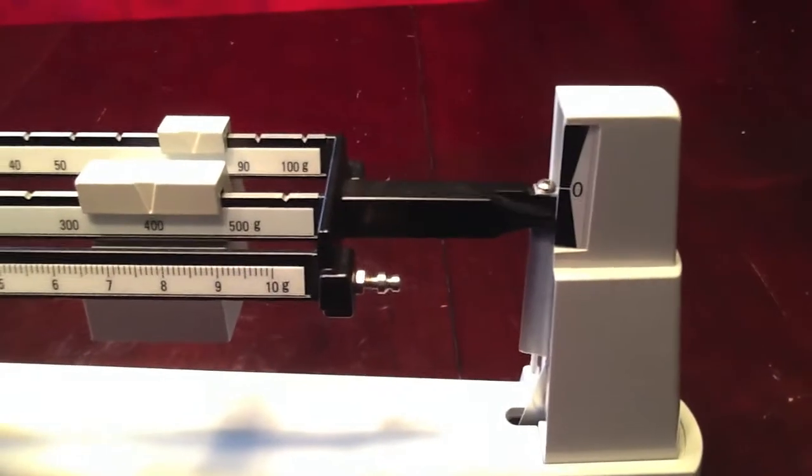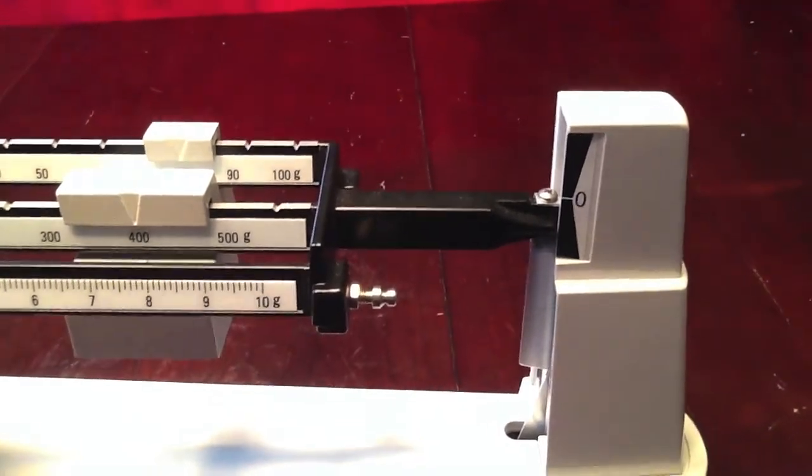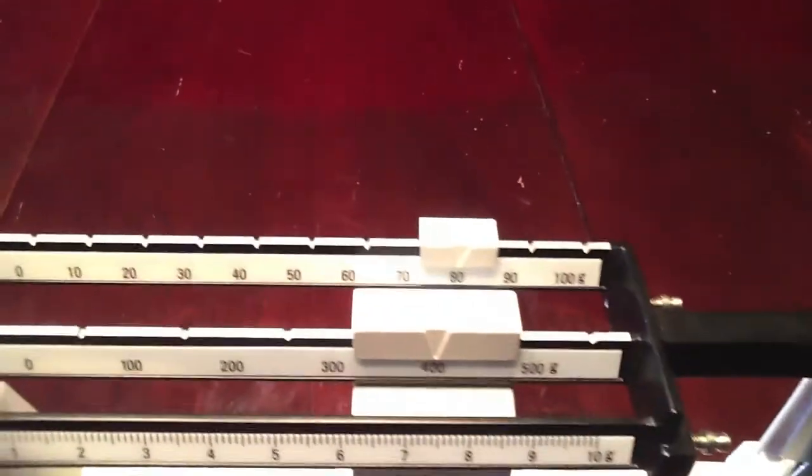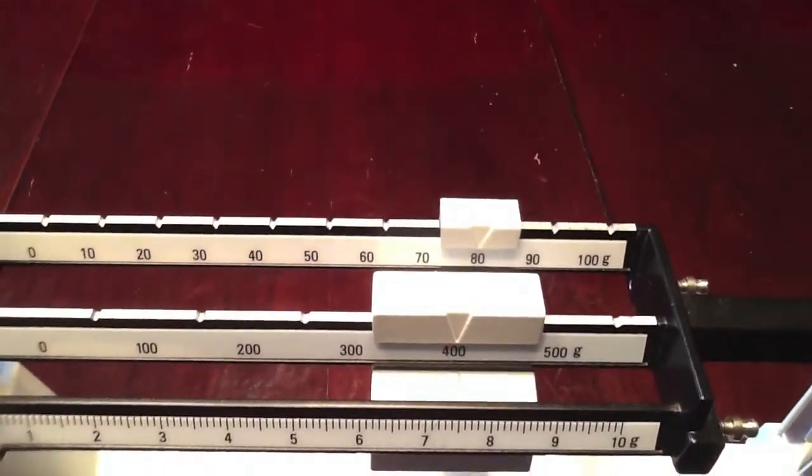Now at 480 grams, we have fallen below zero. So we need to move our 10 gram rider one notch back to 70.